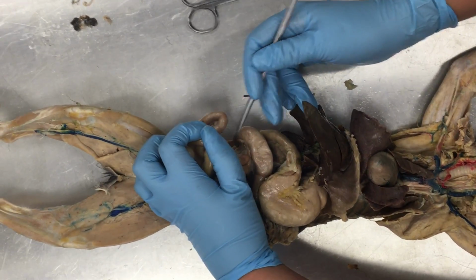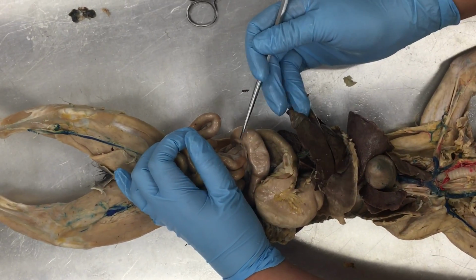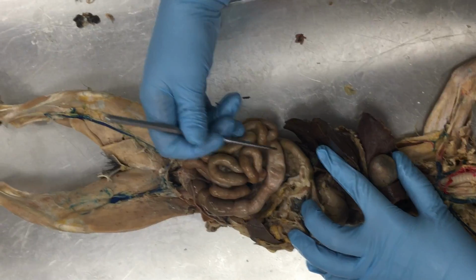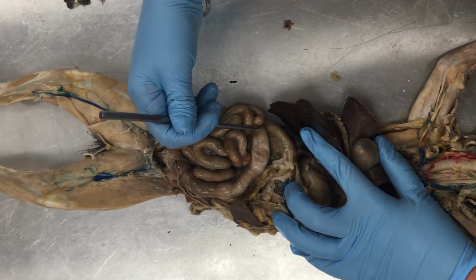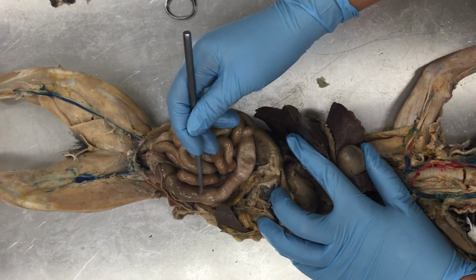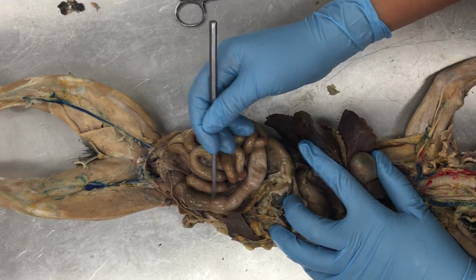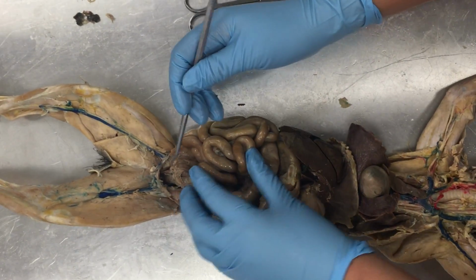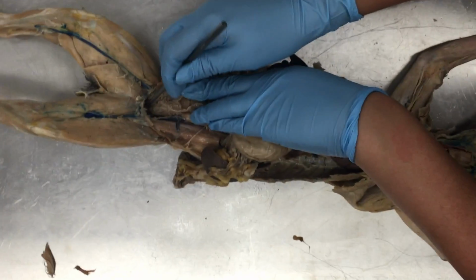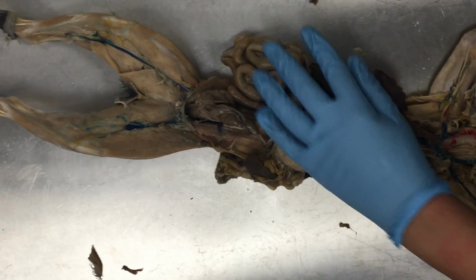All right. From the cecum, we have a small portion of our large intestine that goes up towards the head. That's our ascending colon. Then there's a portion that crosses the body from right to left. This is our transverse colon. Then we've got large intestine coming down the body. That's our descending colon. All right, and then finally, this last bit where it's entering back into the pelvis and will ultimately exit the body, that's our rectum right there. All right, so there's our intestines.